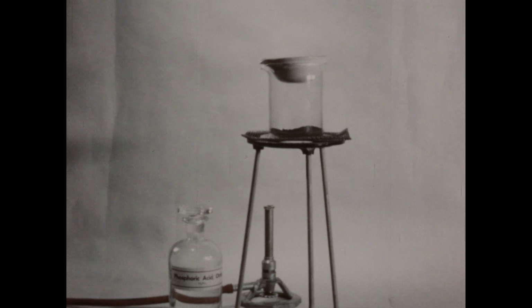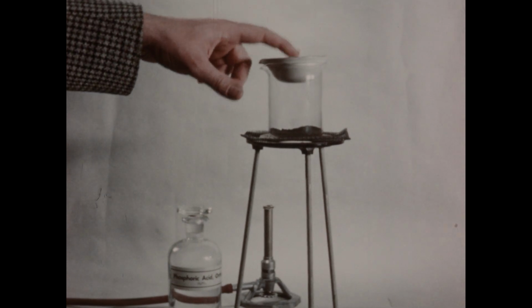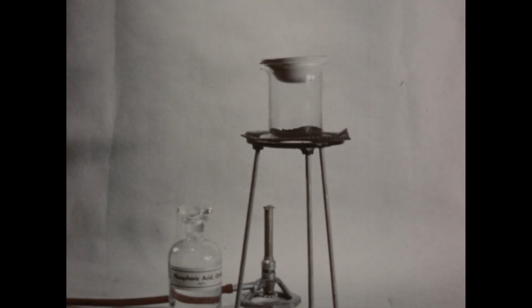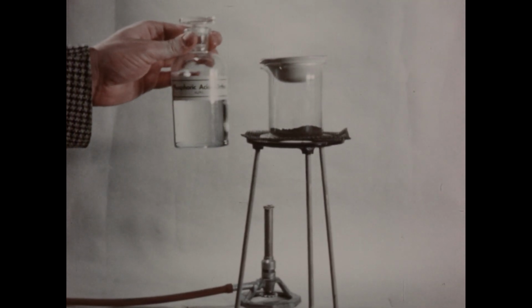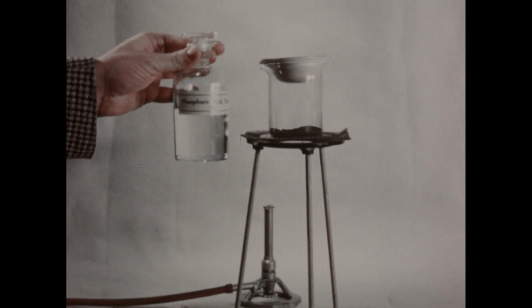Iodine, like chlorine and bromine, occurs naturally in the form of iodide salts, so that an oxidation reaction is necessary in order to produce the free element. In this beaker, we've placed some crystals of potassium iodide and some manganese dioxide, which will again function as the oxidizing agent. In the evaporating dish, we place some cold water, which will serve to condense the vapors of the iodine which are formed. In this bottle, we have some phosphoric acid, which we will add to the beaker in order to cause the reaction to start.